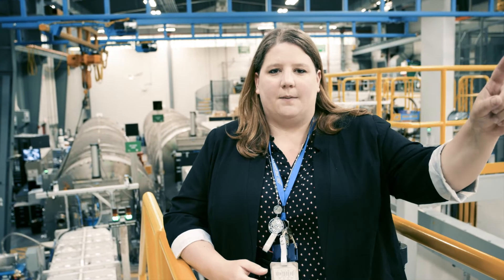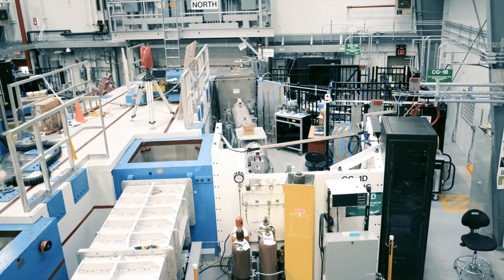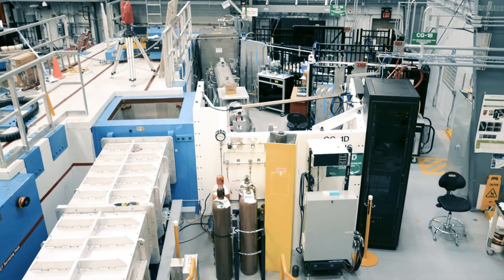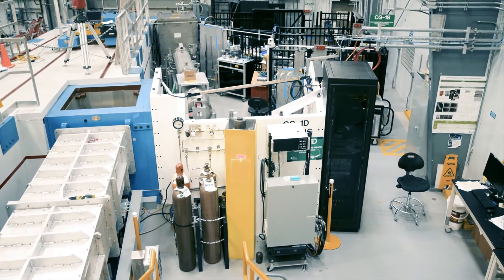We start here where the instrument comes out of the reactor down the HB4 beam tube, comes through this wall where you see this north indicator, and comes down through guides that totally reflect the neutrons.